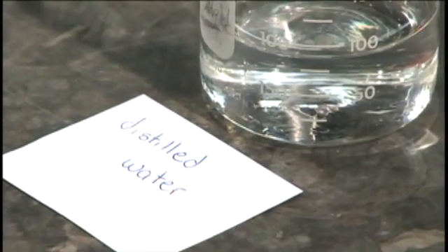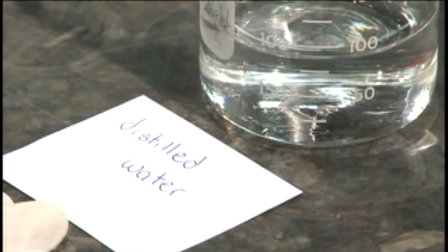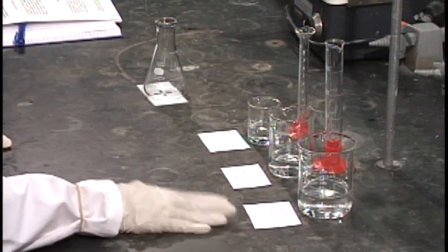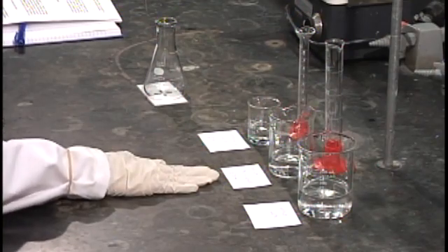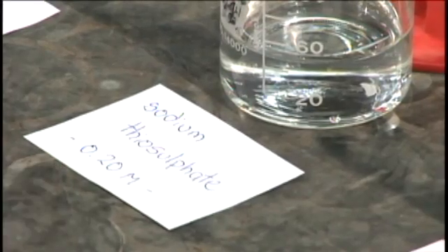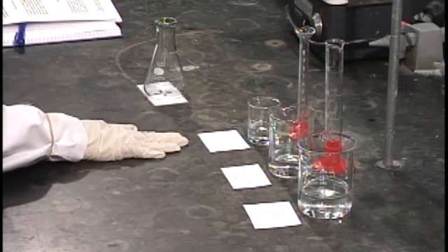To set up, we have distilled water, a 0.2 molar solution of sodium thiosulfate, and a 2 molar solution of hydrochloric acid.